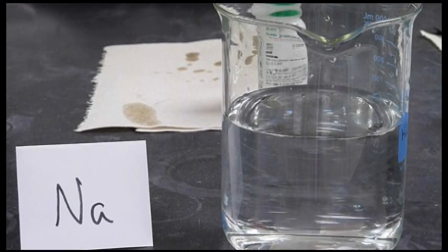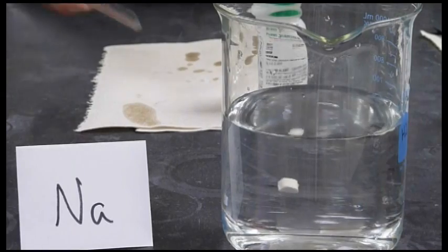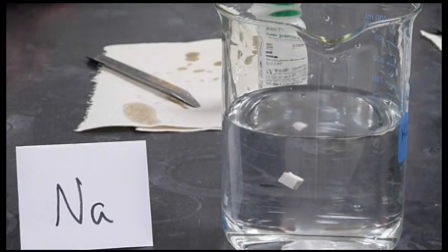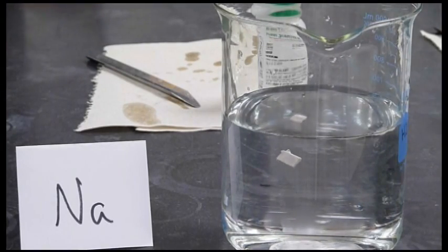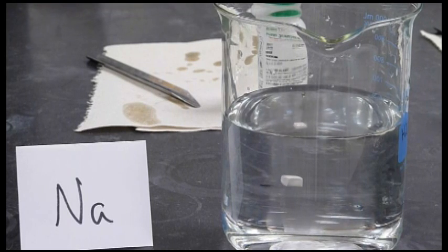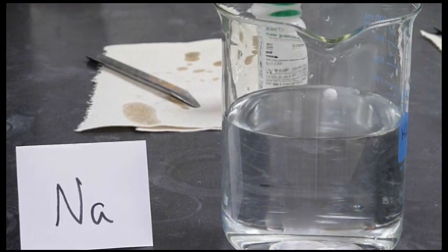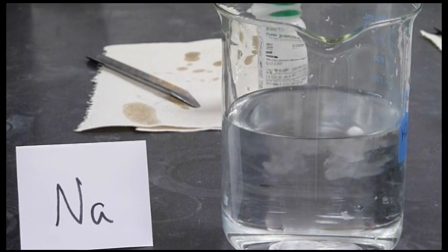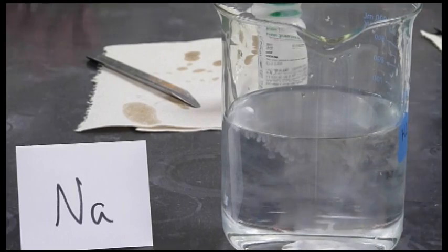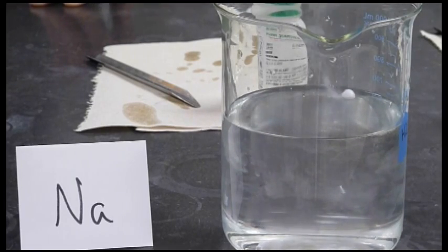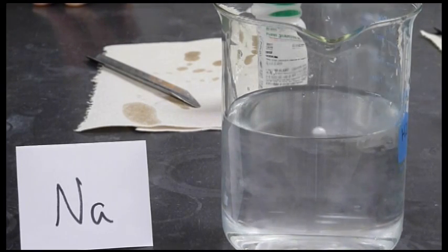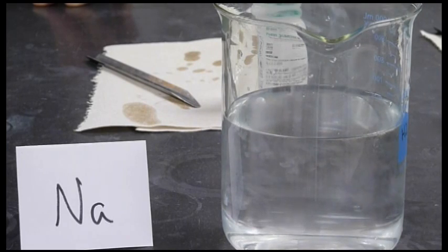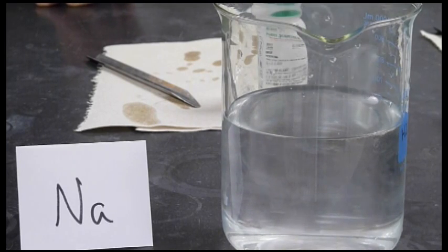The next alkali metal we're going to watch react with water is sodium. Already you can see it's quite a bit more reactive than the lithium. Another interesting thing that sodium does is it forms a sphere on the surface of the water.